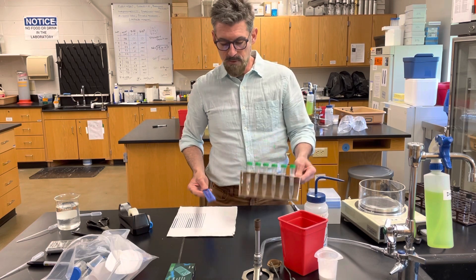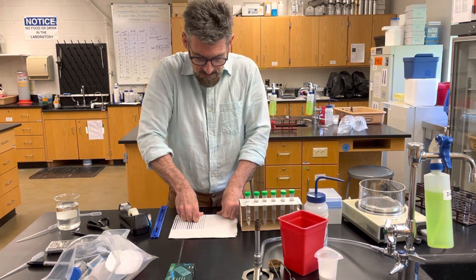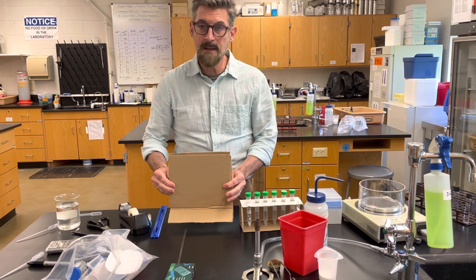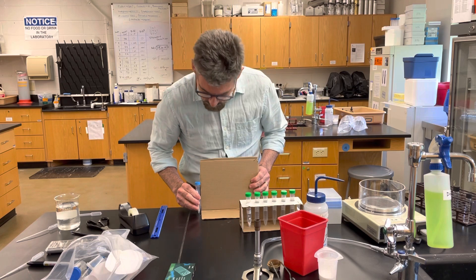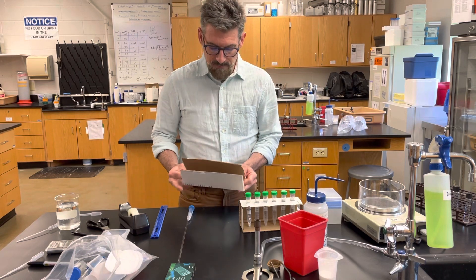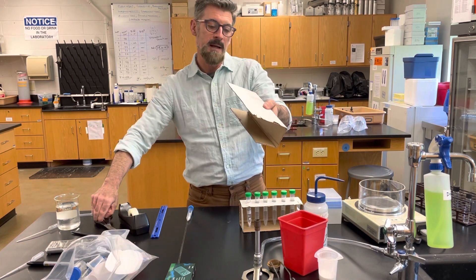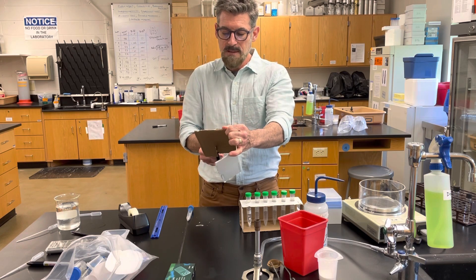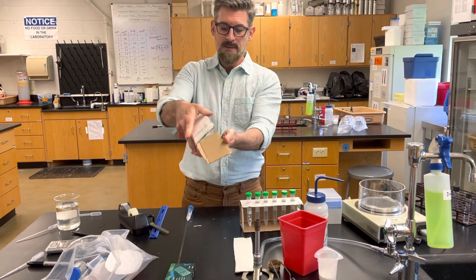The cardboard is curved around — I have my piece and I'm folding it. This is going to be the base and then there's an upright section. Next I fold it over again, but you don't want to fold it too low or too high. Use your test tube as a guide — you want the fold to be somewhere below the tube. That's where I do my second fold. There's a little bit extra sticking off, so I'm going to cut that off to make it neater. Those pieces will also help stabilize the overall rack.